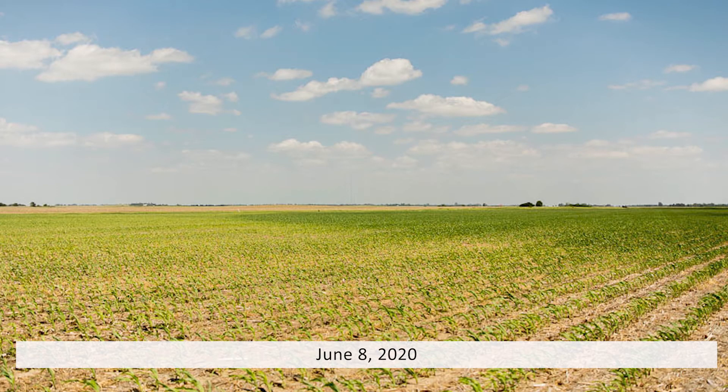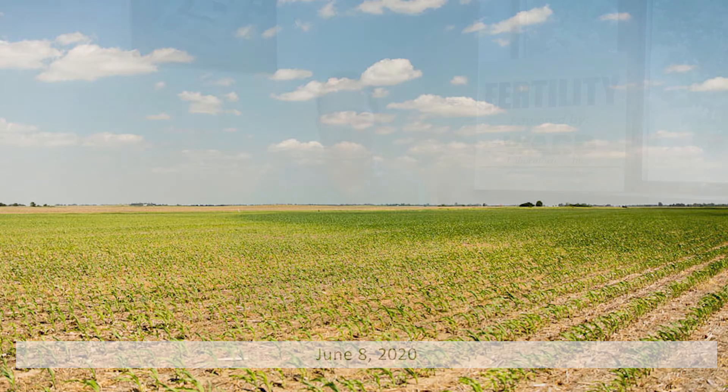Hello and welcome back for another Tuesday Thoughts here with Ward Laboratories. If you'll remember earlier in the summer I visited with everyone about a sulfur deficiency issue in some corn — the irrigated versus the unirrigated portion of the field. As we talked about in that video at the end, we'd go back and grab a water sample in the mid-summer and look at the sulfur content in that well water. Today I've got our test results in front of me and we're going to go through the tests and talk about not only sulfur but also the irrigation water quality tests we offer here at the lab.